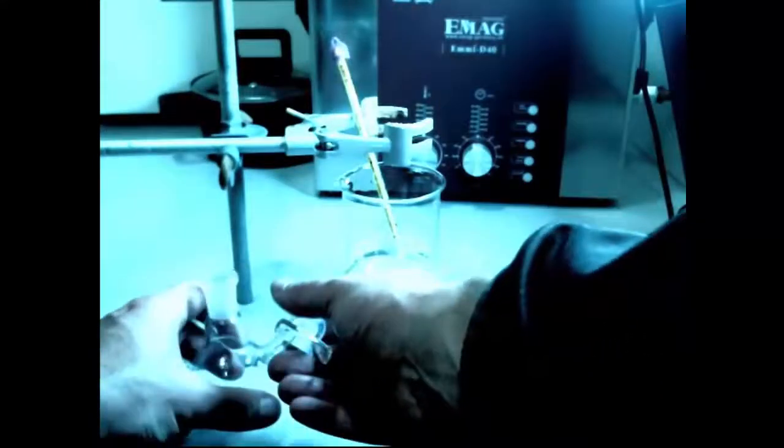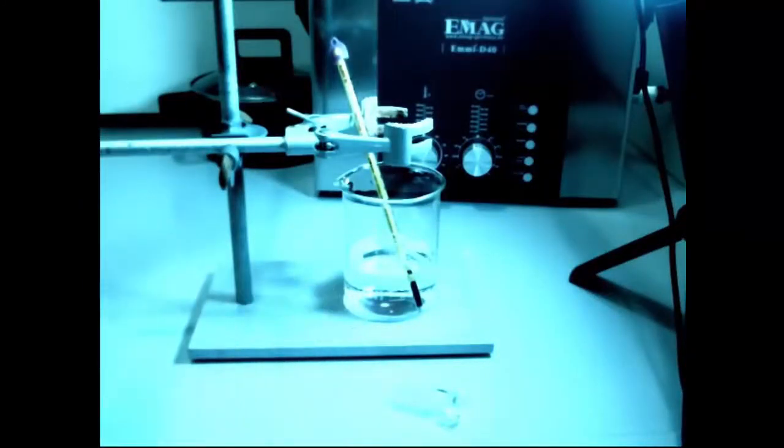So this is our methanol bottle. I've got the video backwards, but never mind. And I'm going to put it into this container. I did try to tip it in on camera, but I got out of shot accidentally there, so sorry about that. It is really methanol in this container. We'll see that in a moment, but unfortunately it's not all one shot.